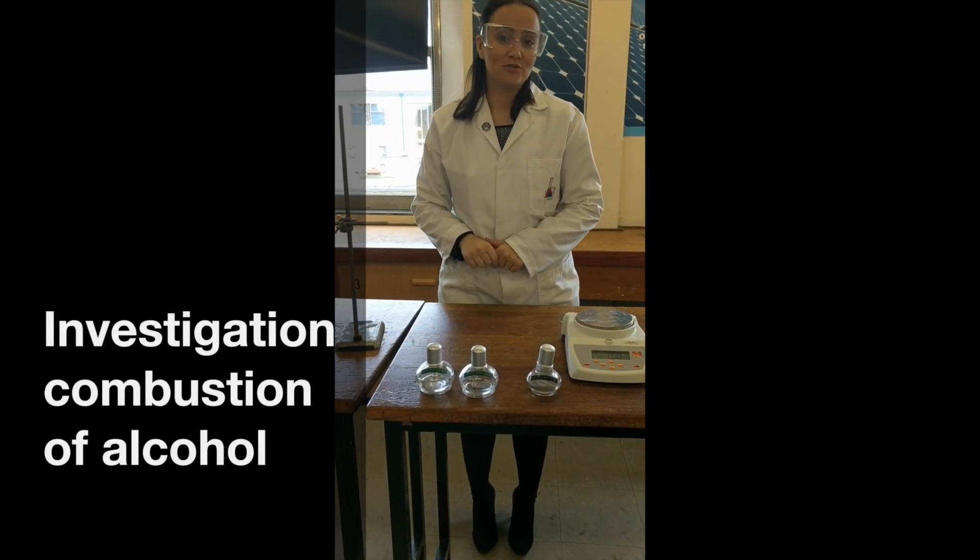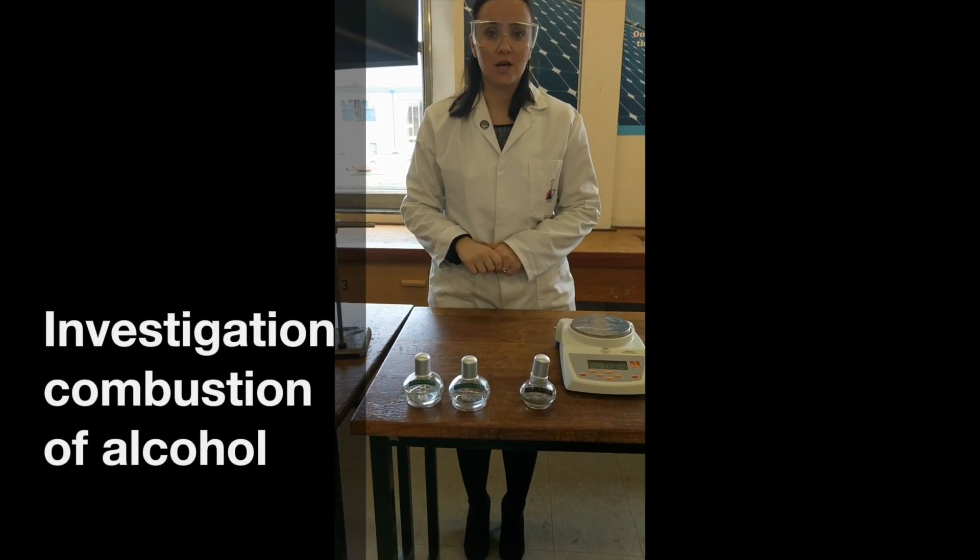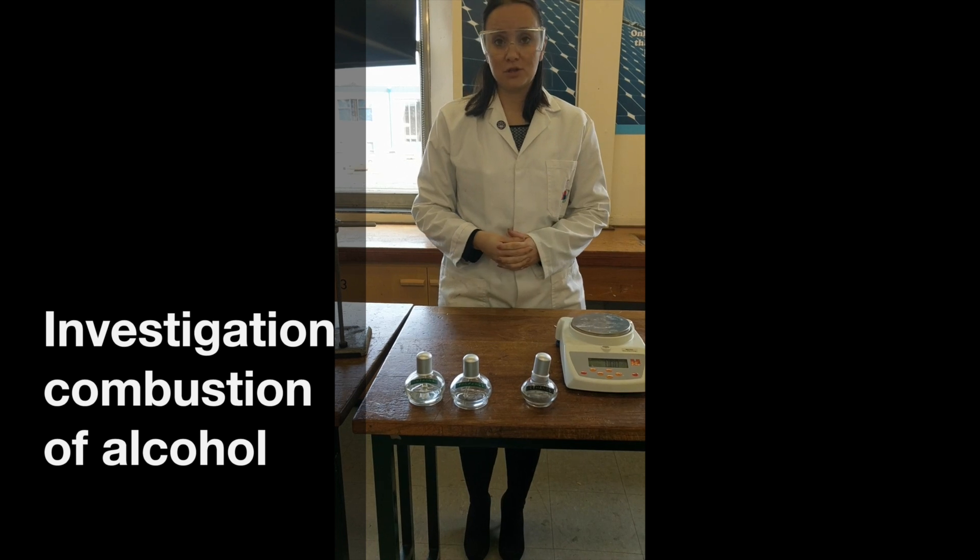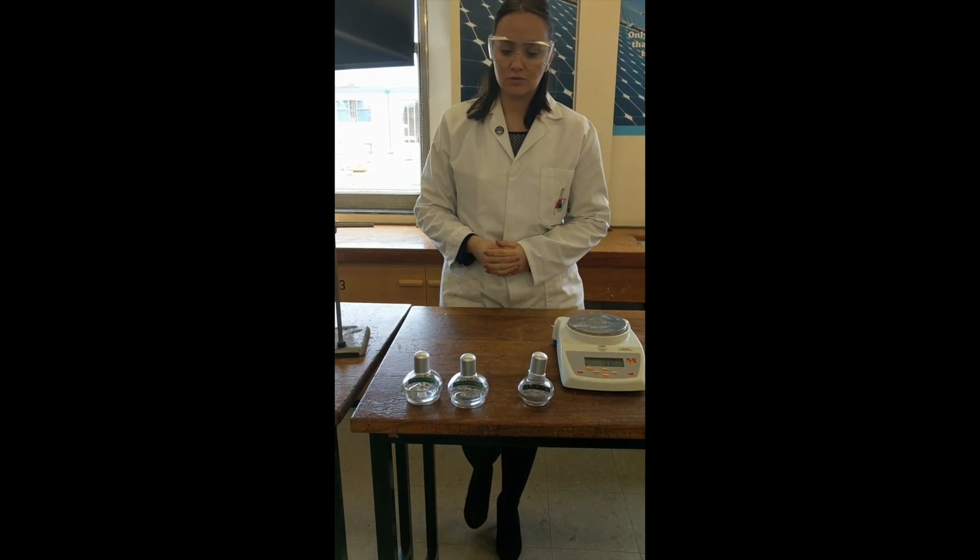Today we're going to investigate the temperature rise of a known mass of water when we are burning fuel. So it's the combustion of different alcohols.